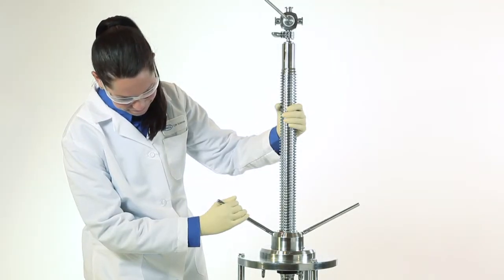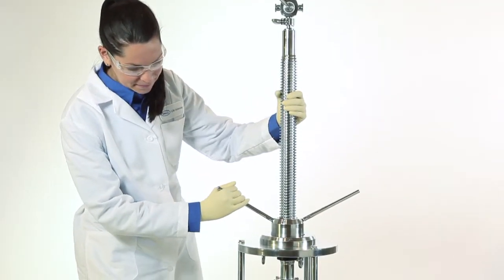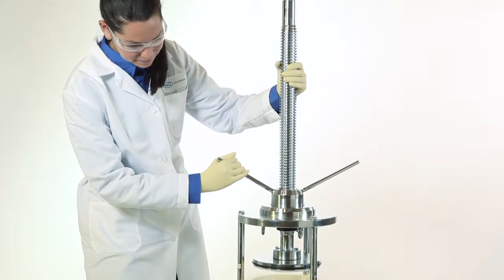Now we'll demonstrate how easy it is to pack the Resolute FM column. First, prepare the column prior to packing.